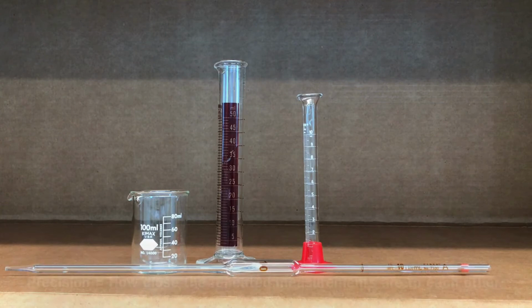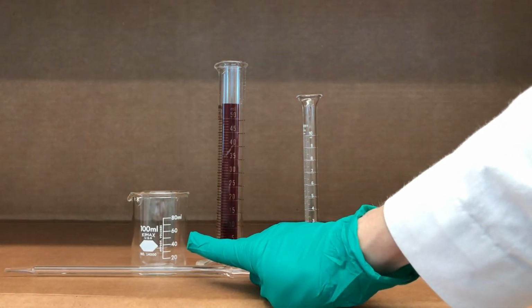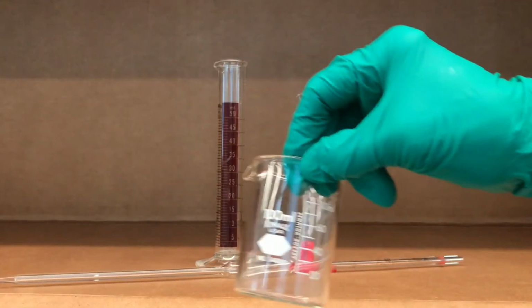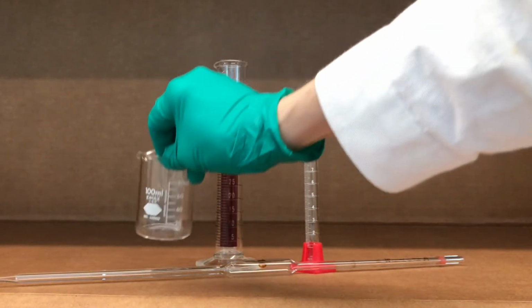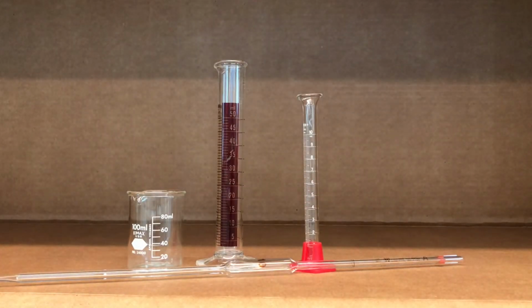The first piece of equipment I have here is a beaker. Beakers are used for approximate measurements. As you can see, even a beaker on its label says approximate volume. So if you wanted to measure, say, 20 mils of a solution, you could pour 20 mils into that beaker up to the 20 mil mark, and you would be sure that it's about 20 mils.